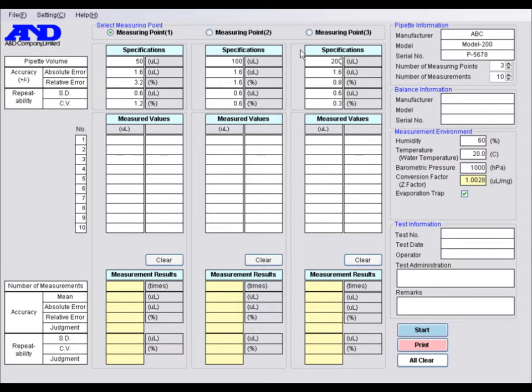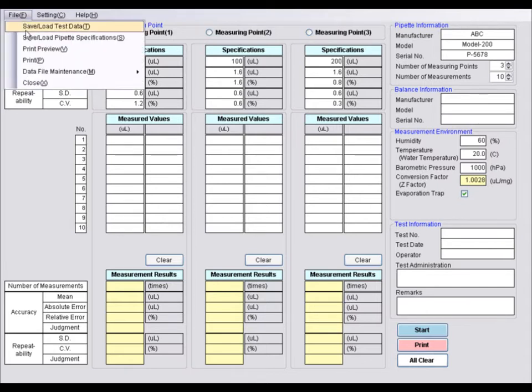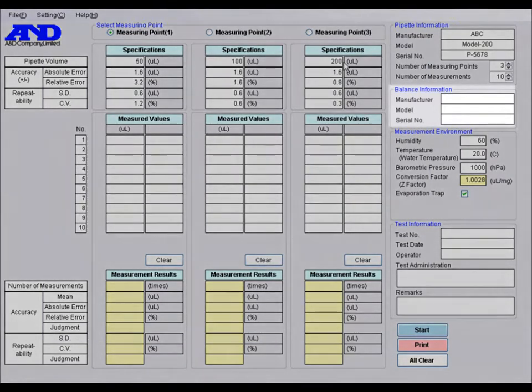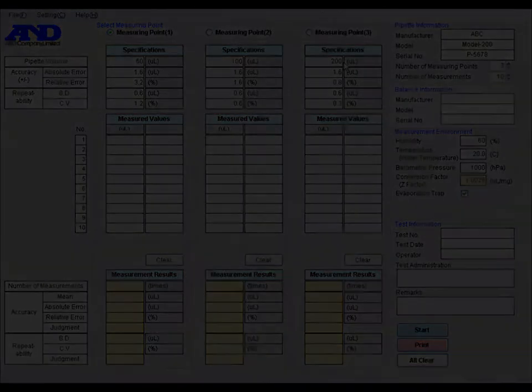These specifications are based on the recommendations of ISO 8655, but can be freely changed to meet your requirements. You also can save pipette information and specifications for future tests with the same pipette. The balance information is automatically entered once measurement starts.